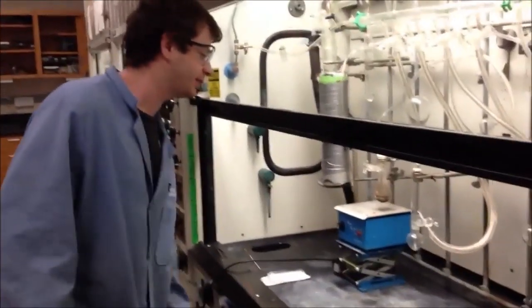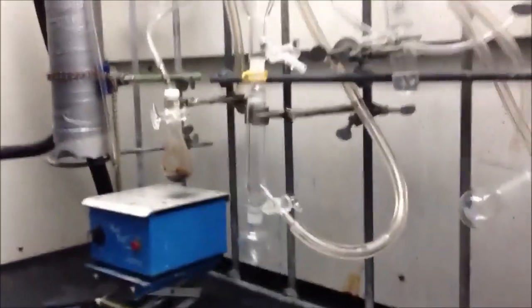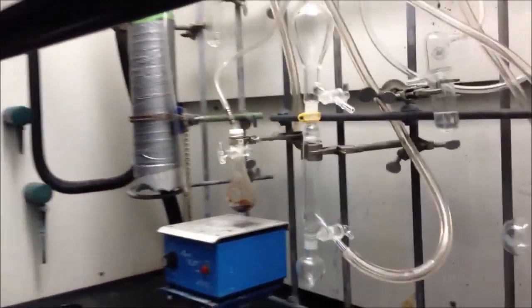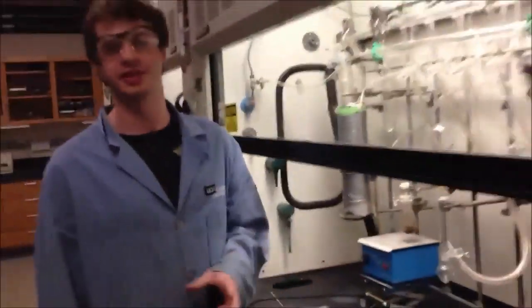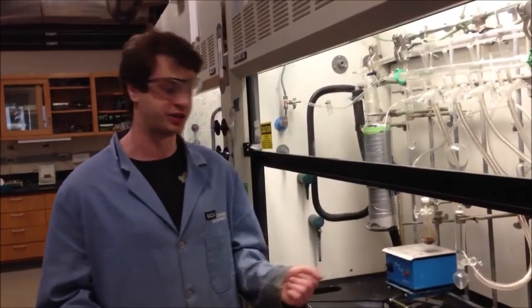Alright, so five hours has elapsed. And now it's time to take a look at what we've got here. So it seems I've removed the oil bath and I let it solidify here. And we've got what looks like a brown sludge. Not so great. Let's see if we can filter that, but of course we need to filter it without letting it touch the air. Because I said previously, the reagent is very sensitive to air and moisture, so we'll need to make sure that during the filtration process, it doesn't come in contact with the outside oxygen.